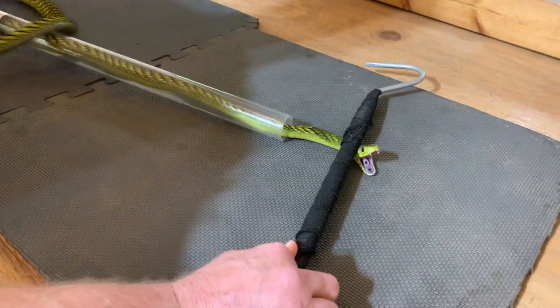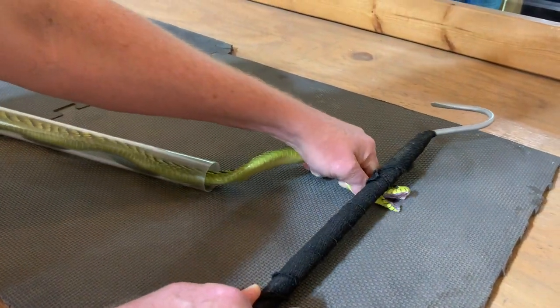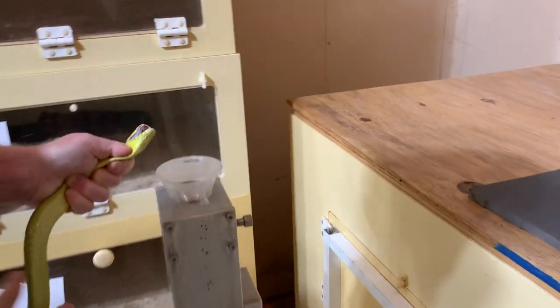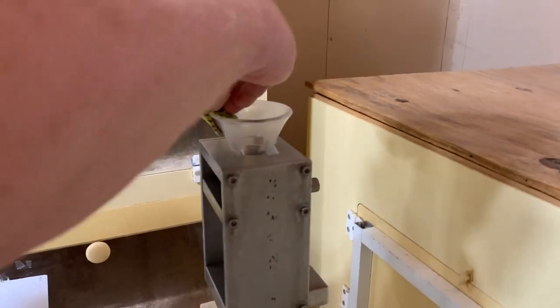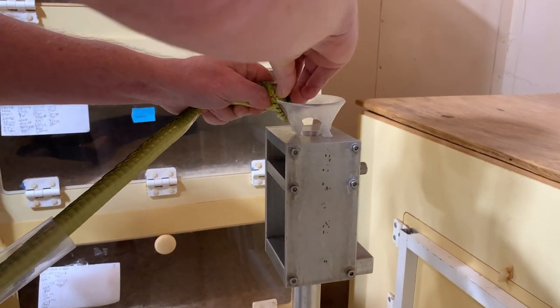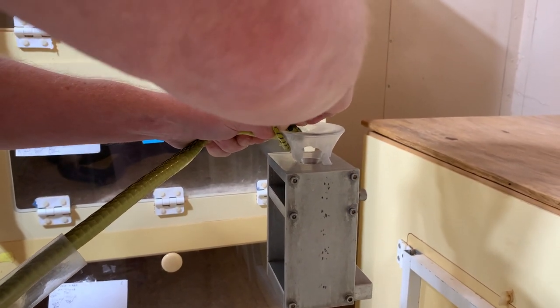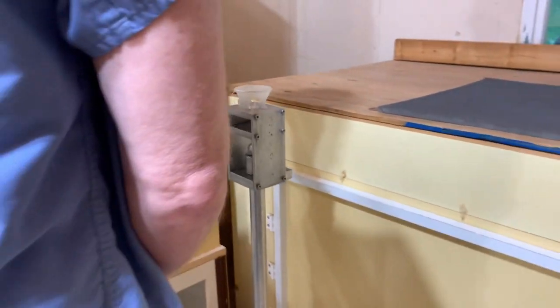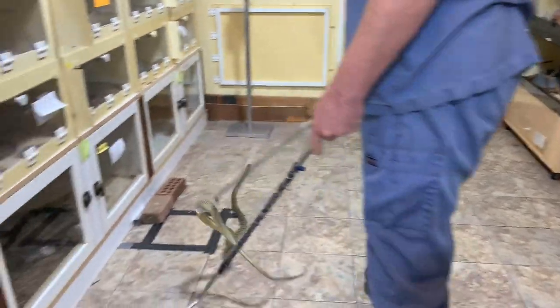There you can see the snake is contained in the tube. That does make a little gap there when Jim went to get the pin, and then he allows it to bite. You can see how flexible the upper jaw of a mamba is — they're actually able to pull their rostrum, or nose, back when they bite. You could see it right when the snake bit down that it was fairly flexible, which is a cool thing to observe.